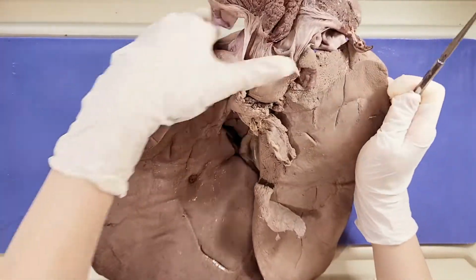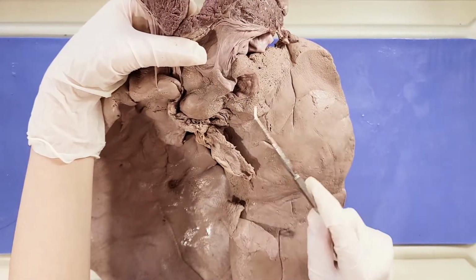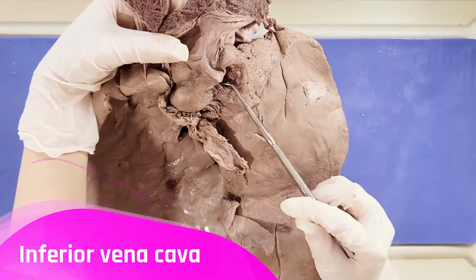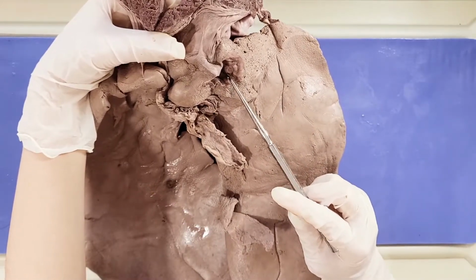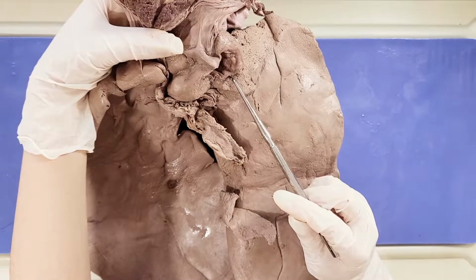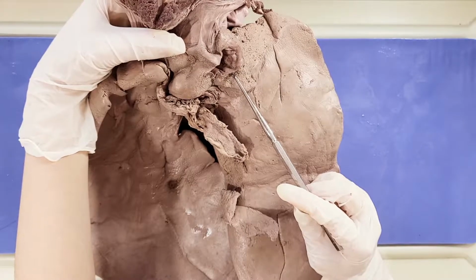And also you can see this large vein right here, which is sitting right inside this groove. This is the inferior vena cava, and the upper end of this goes to the diaphragm. The inferior vena cava is a vein that carries deoxygenated blood from the lower half of the body to the right atrium of the heart.